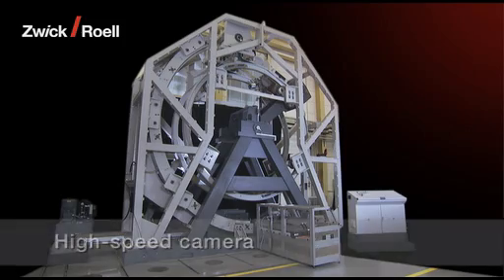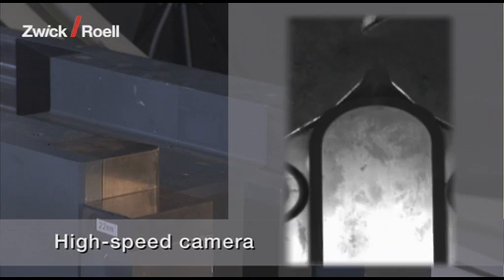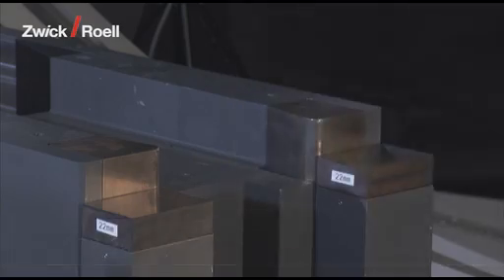As the hammer impacts the specimen, a high-speed camera records the test procedure live at 30 kHz. The images can be evaluated on computer directly after the impact.